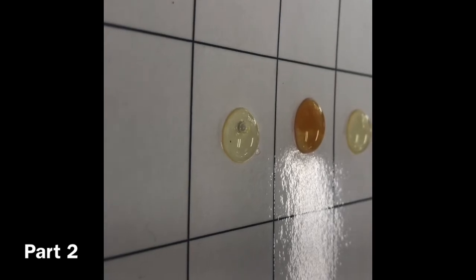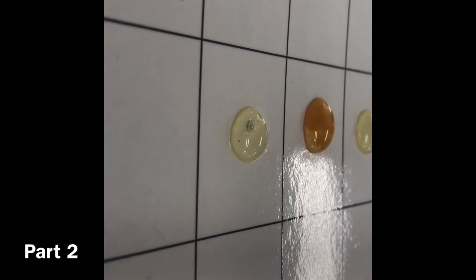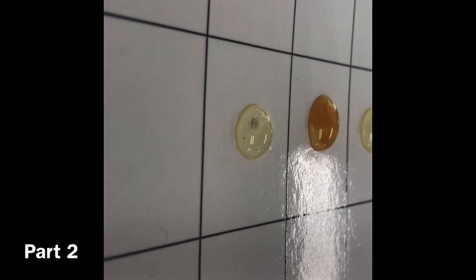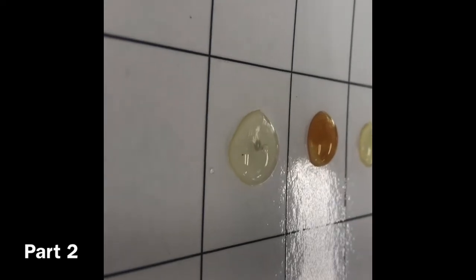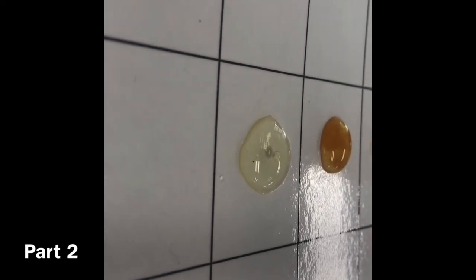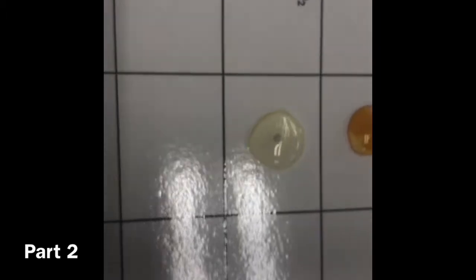Alright, looking pretty clear so far. Thanks for preparing all this stuff for us so we can set it up and do all this fun stuff. Yeah, thank you. Let me wipe this. That could be bad. So nothing happened there. It seems to have not changed at all.